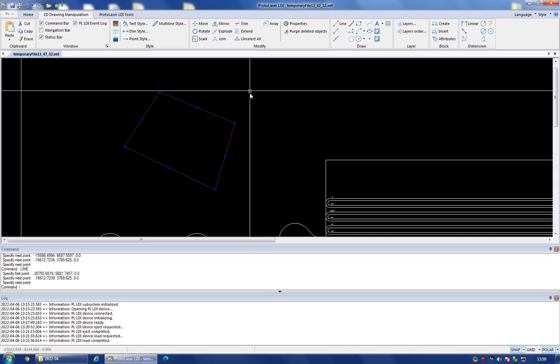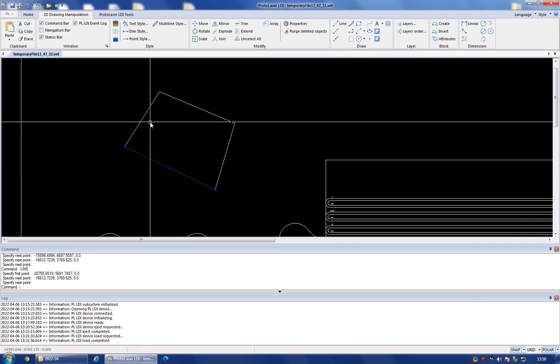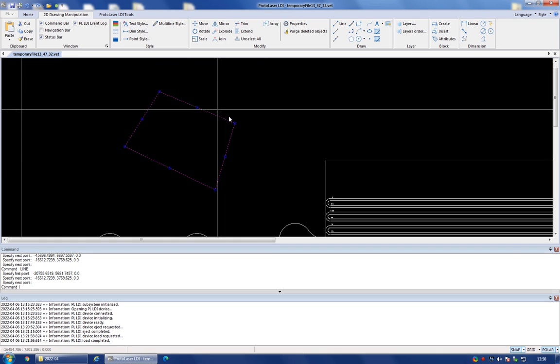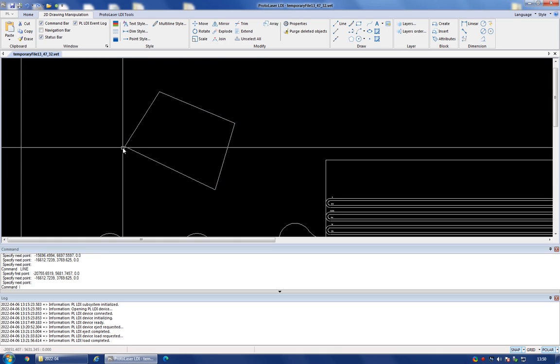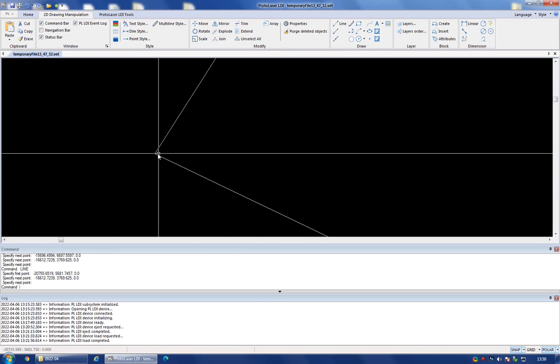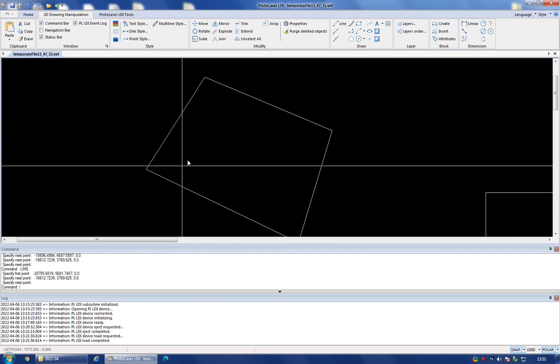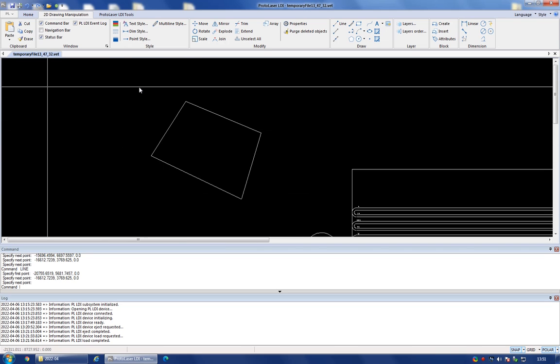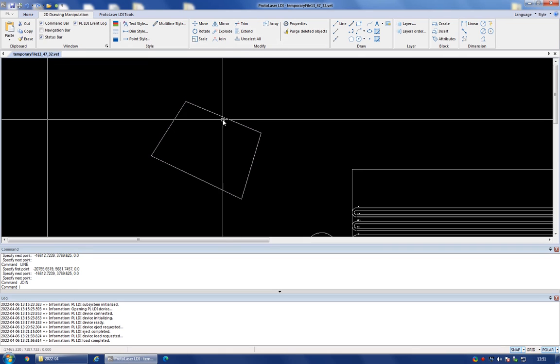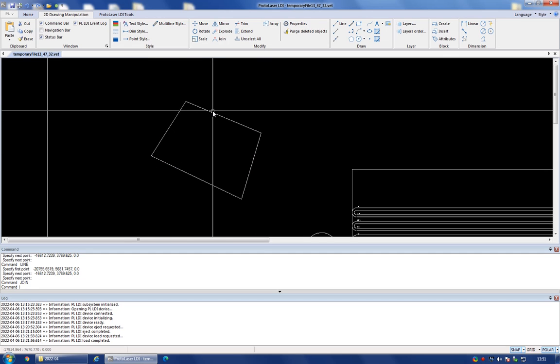And now you can actually see that this shape that I've drawn is a collection of 4 lines. This is not a single line, but a collection of 4 lines that just happen to start and end in the right places. So as much as I zoom in, these lines will terminate exactly in the same point. This is what you want, but to make sure of this, you can select an enclosed shape and hit the join button, and this will make sure that all the lines you have selected inside your shape actually belong to a single shape.